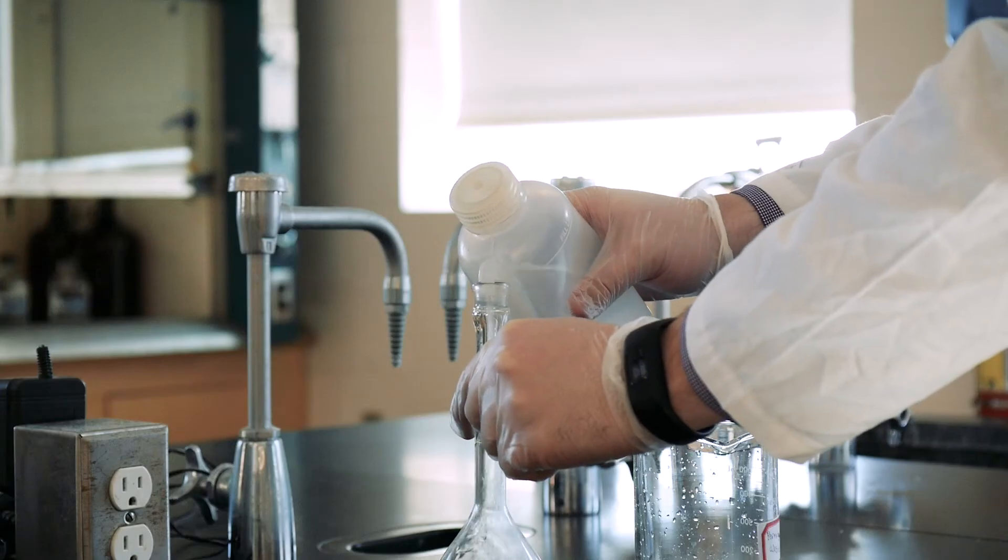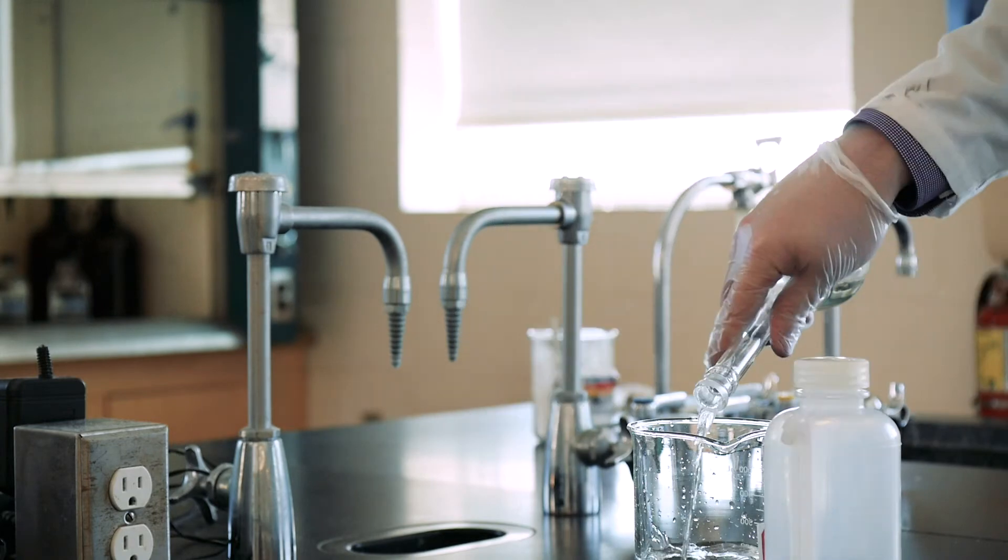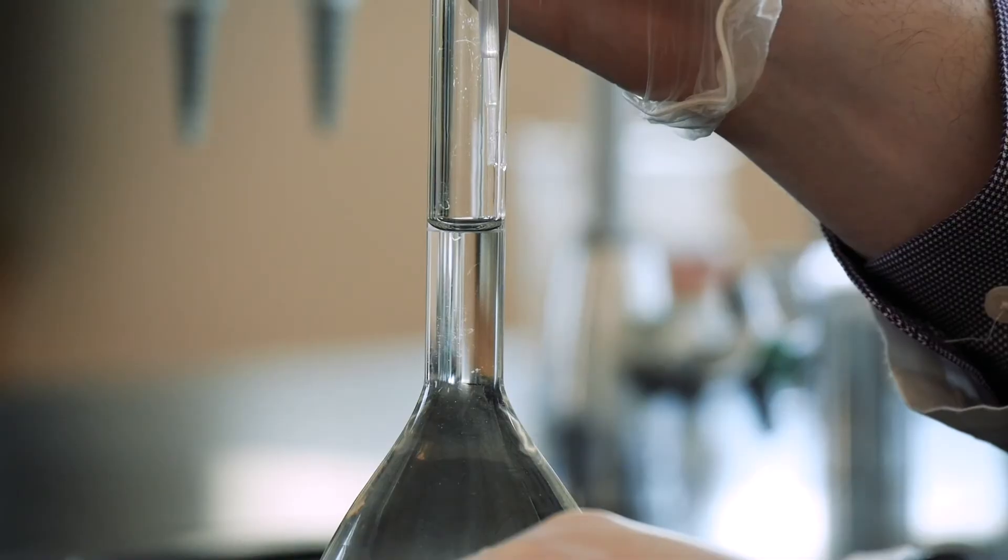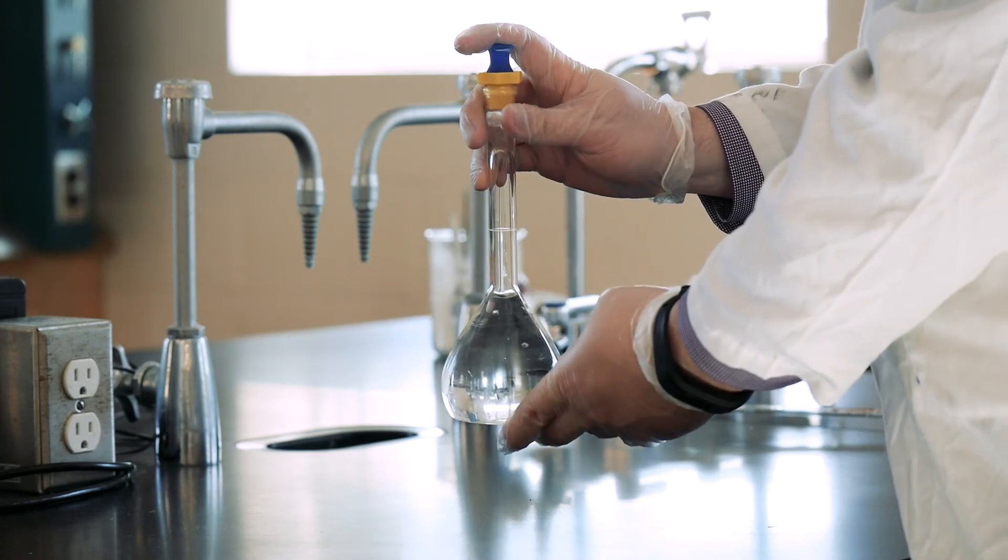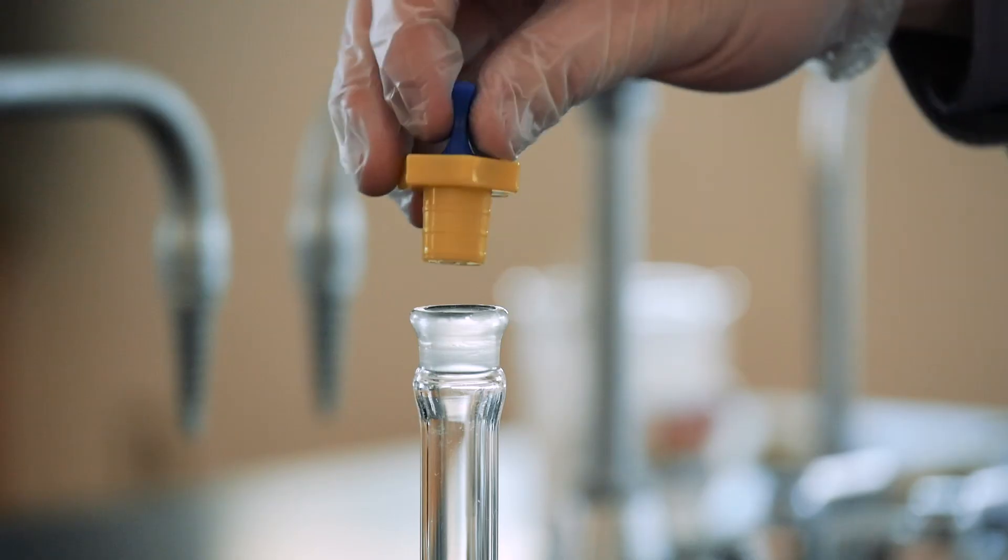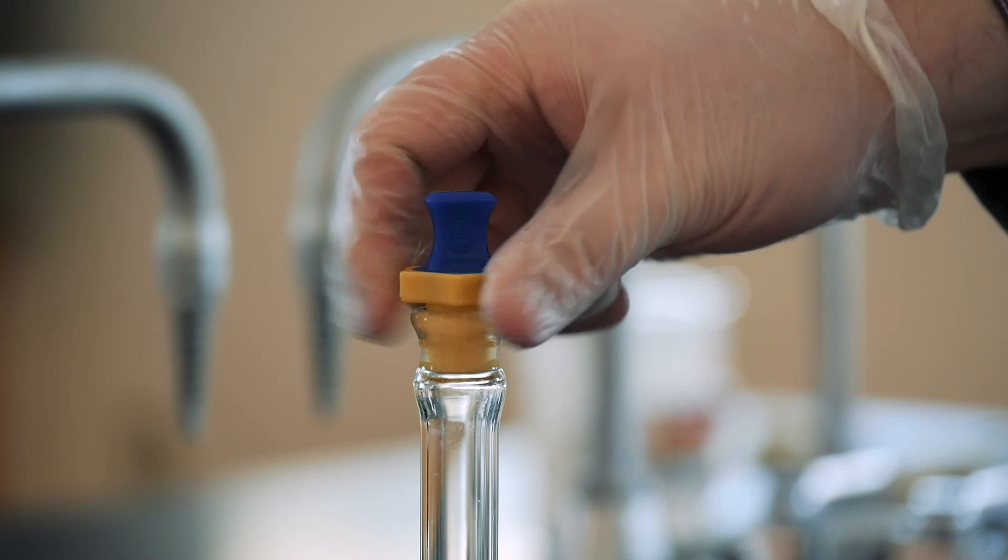So to summarize, don't forget to clean the glassware thoroughly before use. Align the meniscus with the calibration line properly, mix the contents of the flask thoroughly and secure the stopper properly to prevent leaking.